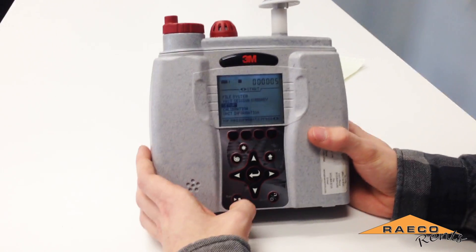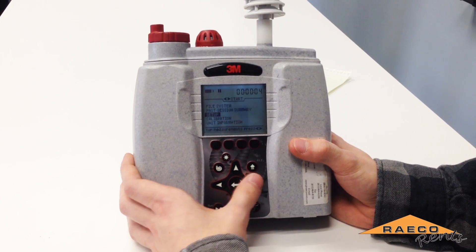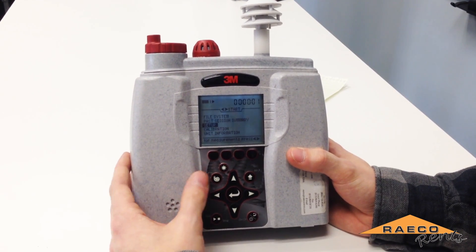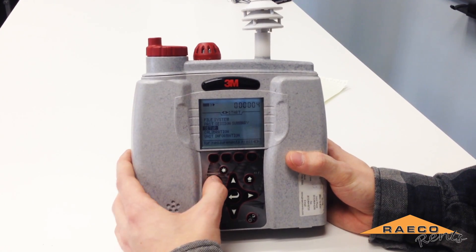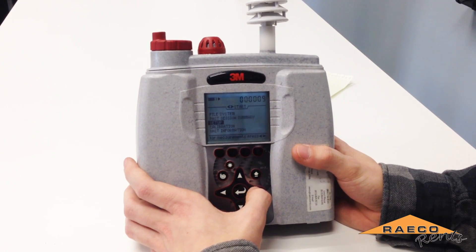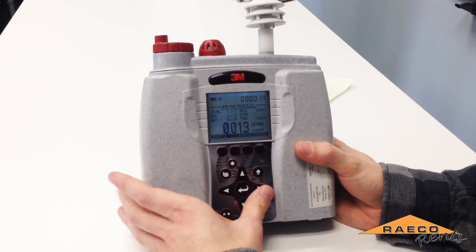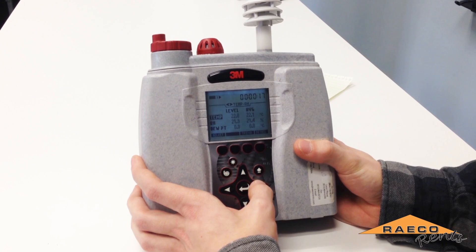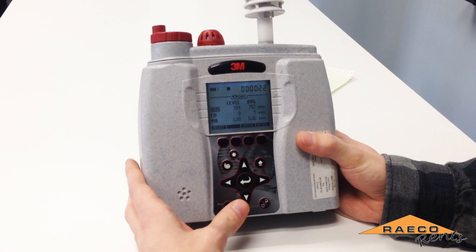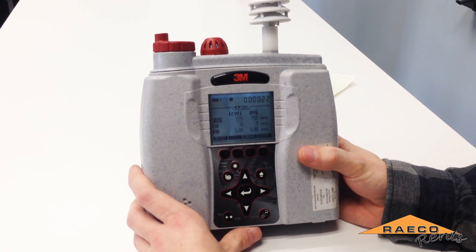When you're ready, press the run/stop button in the bottom left corner. If you have the particulate sensor enabled, you'll hear the pump come on immediately. If not, press the pump button to enable or disable the particulate pump. Once it's running, you can navigate through each display and see your readings in real time. When you're done, press the stop button. Any readings you chose to log will be saved to the instrument's memory and you'll be ready to download your data.